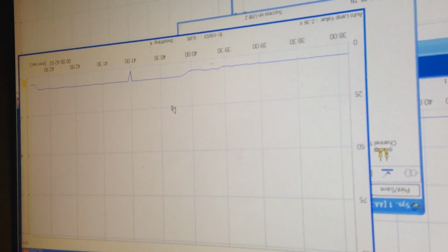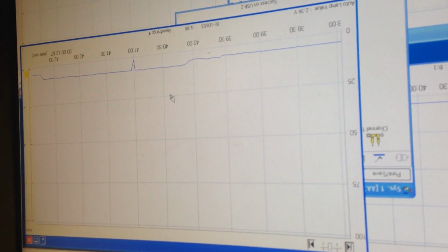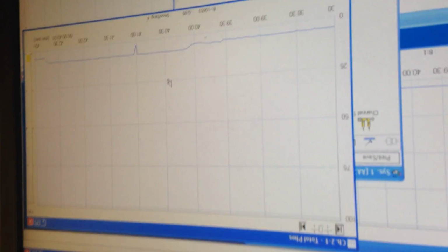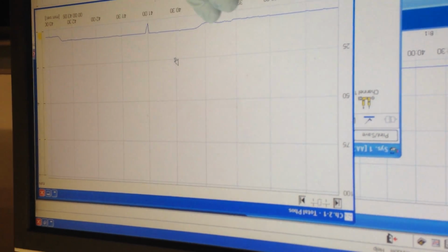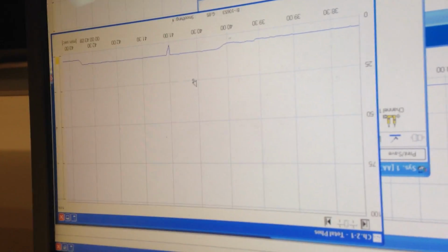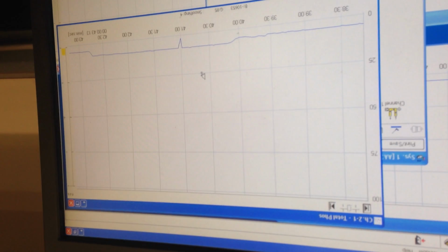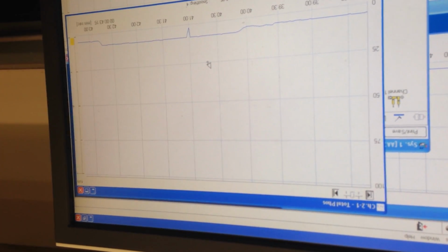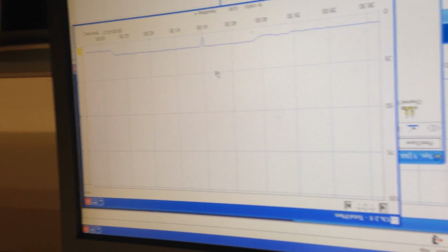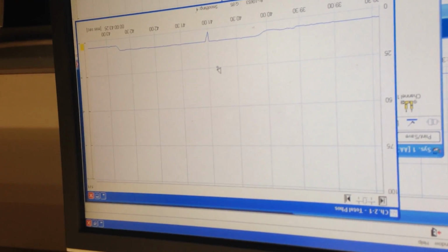So let the reagents come on, set smoothing, let it stabilize, and then set baseline back to 5%. Okay. This was a signal for the reagents, and then you set smooth, set baseline. Yep. You set smoothing with the reagents to smooth the signal out. And then you set baseline so that you tell the machine that this is baseline with the reagents.